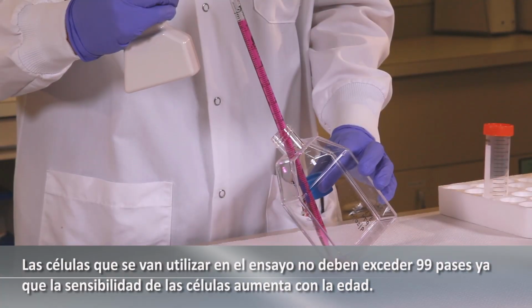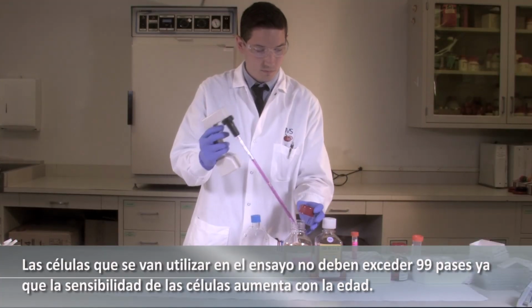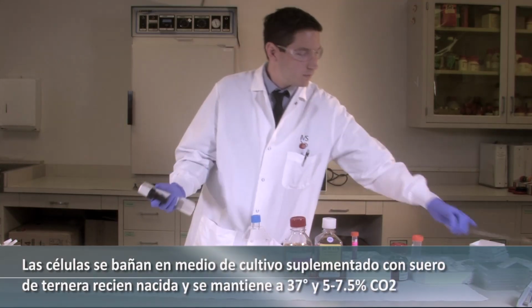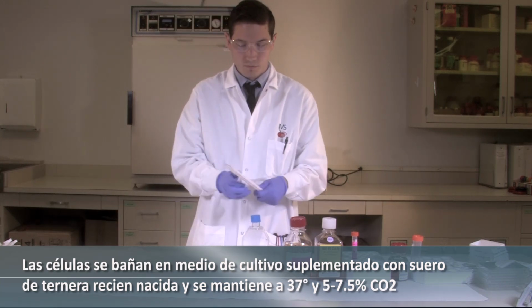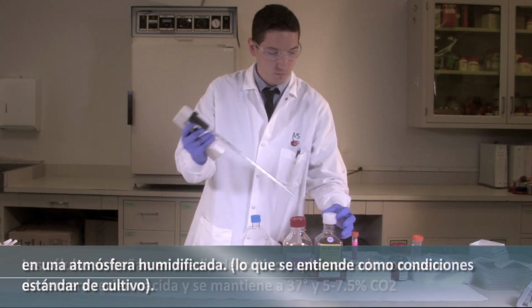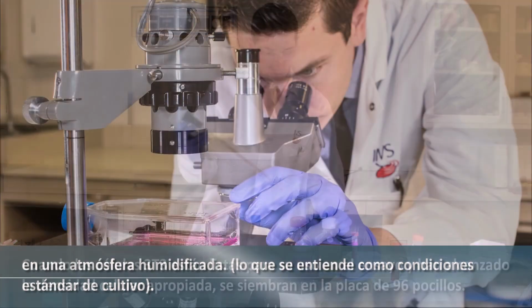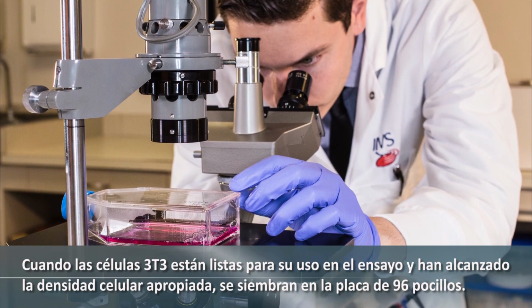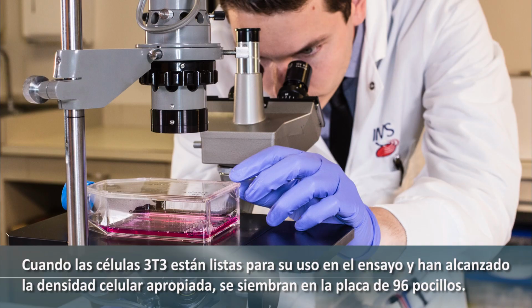Cells to be used in the assay should not exceed 99 passages since the sensitivity of the cells increases with age. The cells are bathed in culture medium, supplemented to contain newborn calf serum, and maintained at 37 degrees Celsius and 5 to 7.5% CO2 in a humidified atmosphere, also referred to as standard culture conditions. When the 3T3 cells are ready for use in the assay and have reached the appropriate cell density, they are seeded into the 96-well plates.